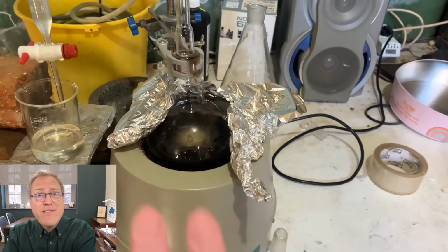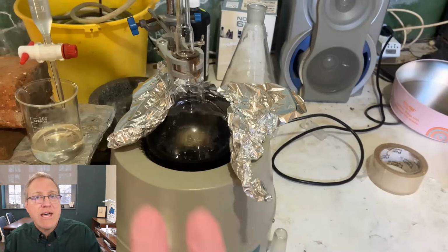Okay, so just a little recap. That's his flask. His flask contains his product. It also contains a solvent and still contains that acid catalyst. He didn't want to cook it indefinitely in acid. So if the reaction's done, let's get this to stop. So he needs to remove that toluene. He'll remove that through allowing the toluene to continue to boil over, and he'll collect that toluene. So that'll get rid of the toluene. He'll have to take care of his acid. He'll have to neutralize that acid. And then he'll be able to address his product, which is in the dark material in that flask.